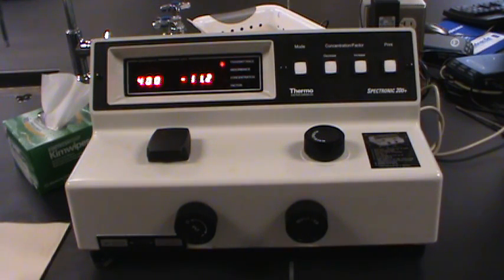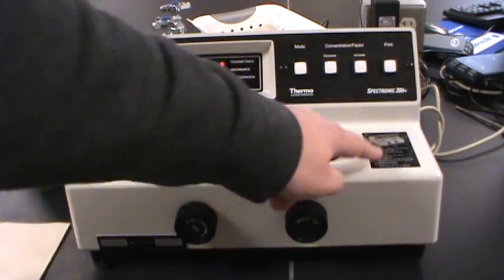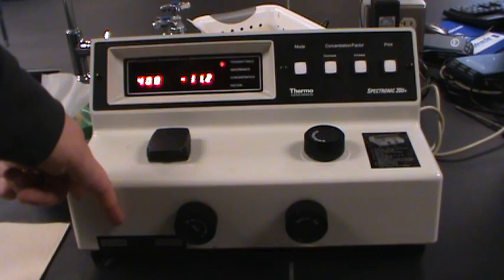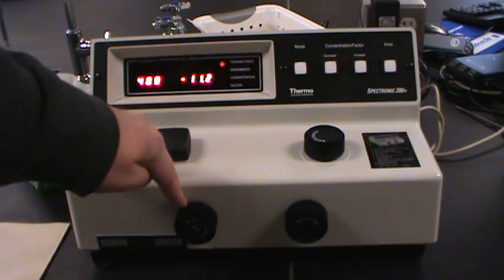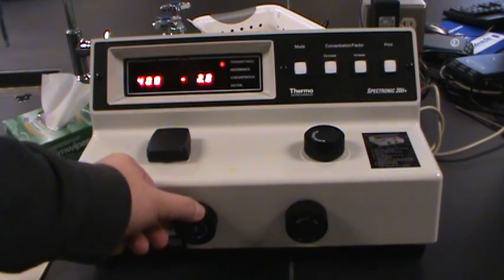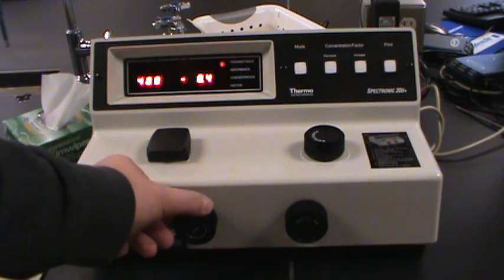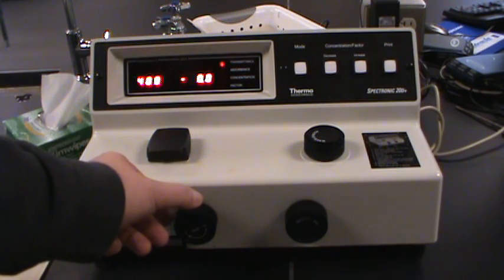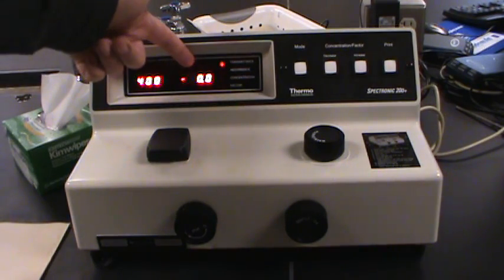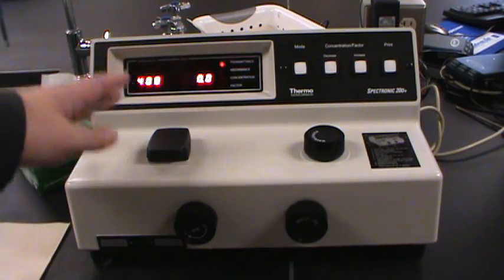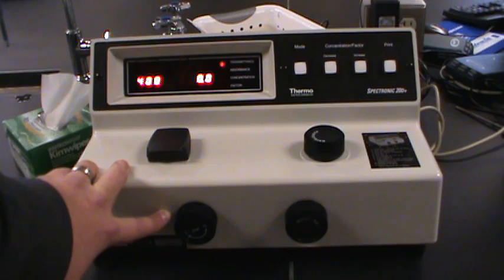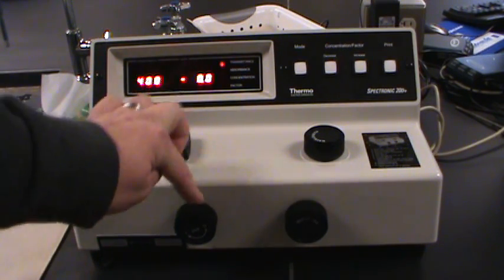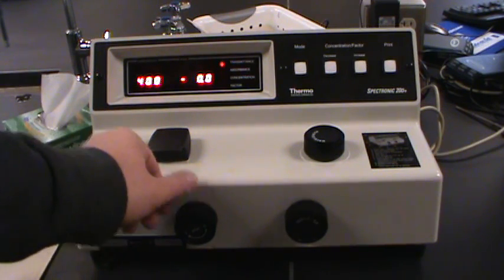What about that percent transmittance reading? Well over here the panel told us that after we set our wavelength and have the filter in the right position we need to adjust the zero percent transmittance. So that's the zero percent transmittance dial. Let's adjust that to zero percent transmittance. And sometimes these dials can be kind of touchy, so you have to be a little careful. There's my zero percent transmittance. So zero is set. Now once this instrument's warmed up, as soon as you set zero at the beginning of your experiment, it should be good for the rest of your experiment. You should never have to touch this dial again like I just did. Whoops. There, let's back it up.